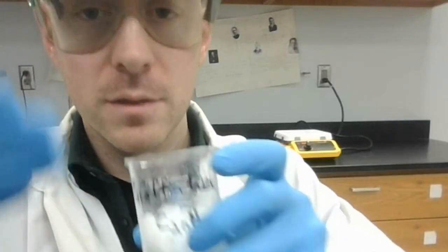Now, the next test is the smell test, a very silly test to watch someone else do. I will run the same samples in the same order, and I'll also call them out before I do so. What you'd like to record is either smells or does not smell. We'll start with the paraffin wax.